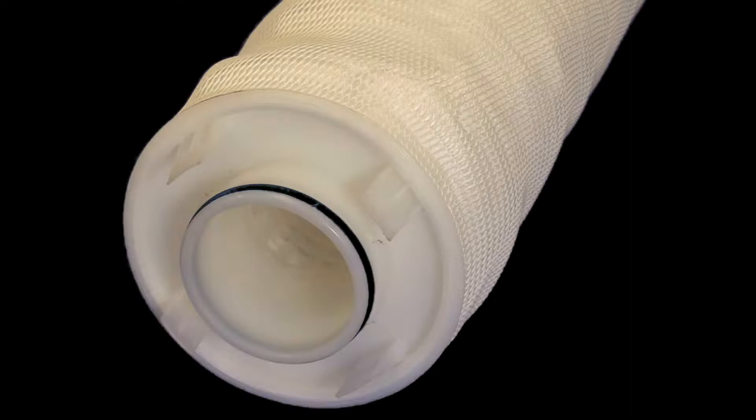The installation of a 3M high-flow filter into a 3M sanitary high-flow housing is a simple process.